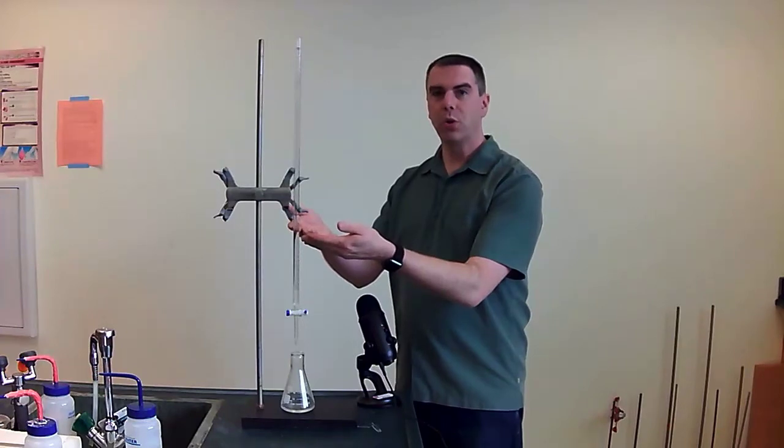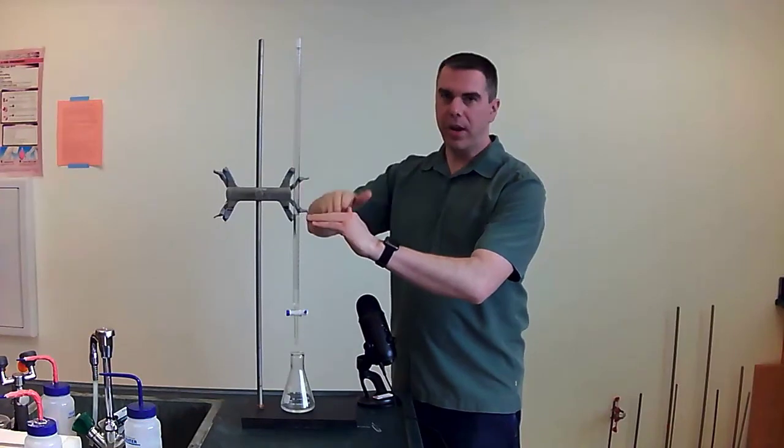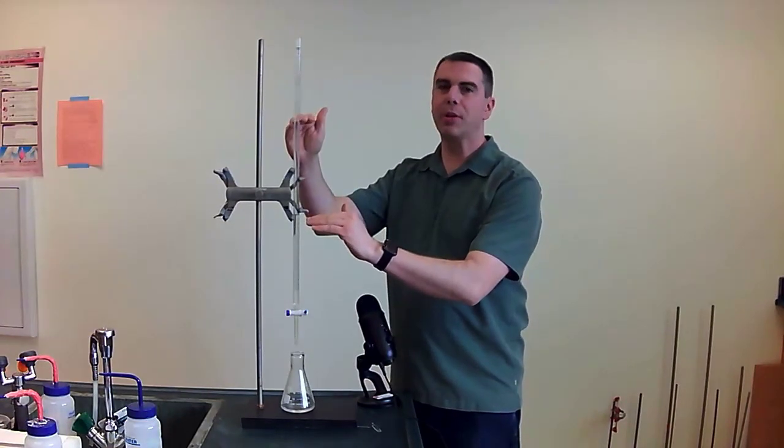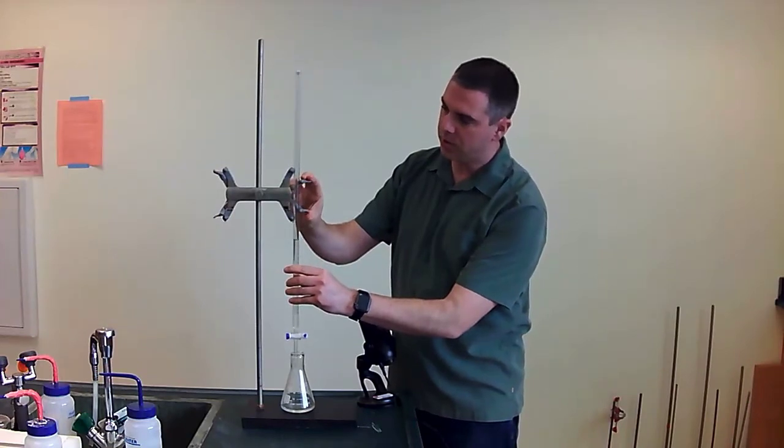And now you'll want to record an ending value. So you know where you started, you know where you ended, and then you'll calculate the difference to discover how much liquid you added. So I'll scoot this down and then I'll zoom in so you can see the final measurement.